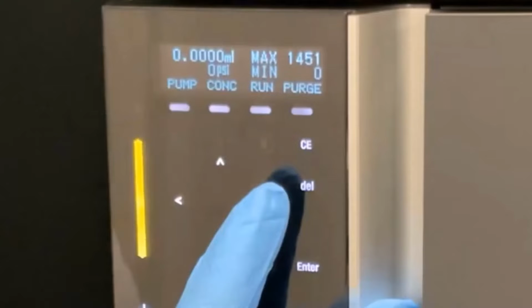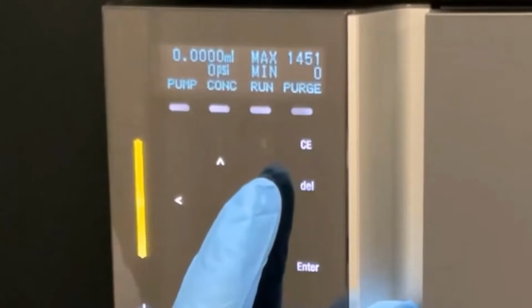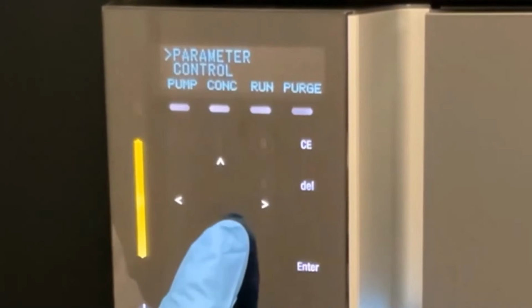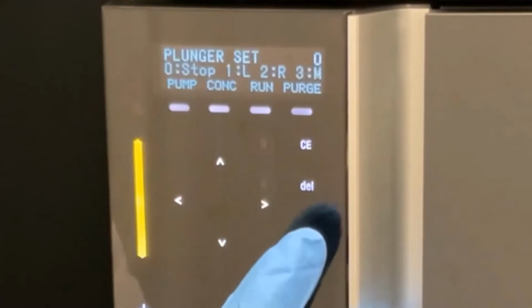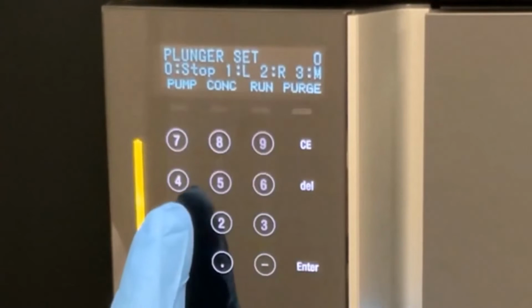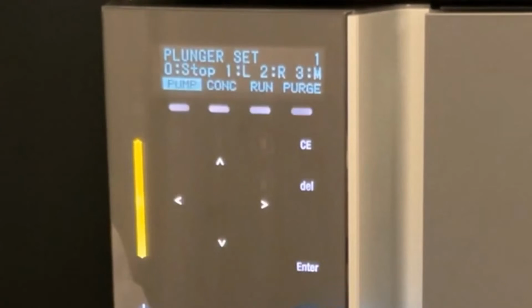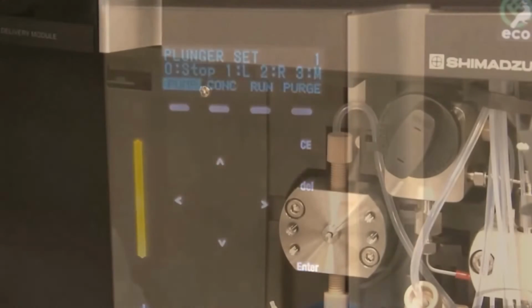Begin by using PSET to set the plunger to the backmost position. From the main screen, press the right arrow twice. Select Control, and then press the right arrow followed by Enter. Select the pump head you will work on, either left or right. Make your selection and hit Enter.